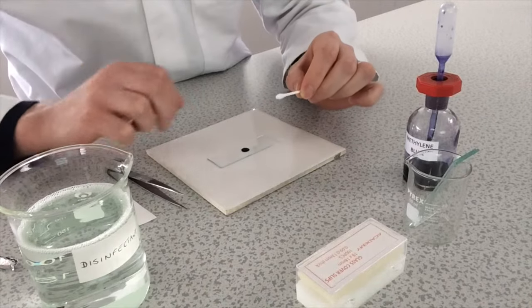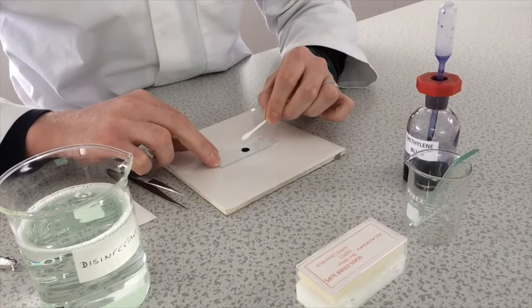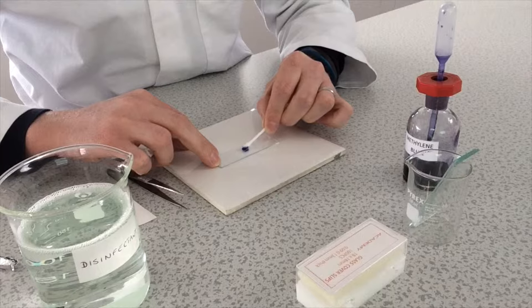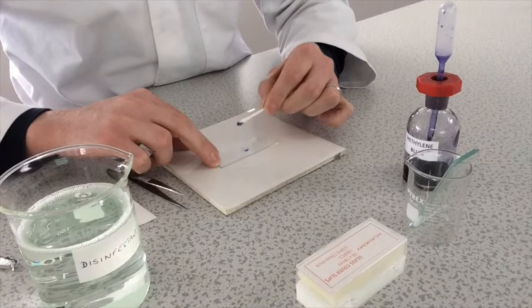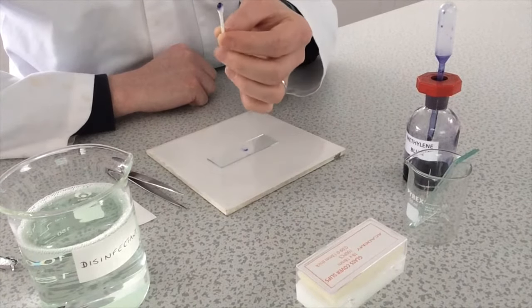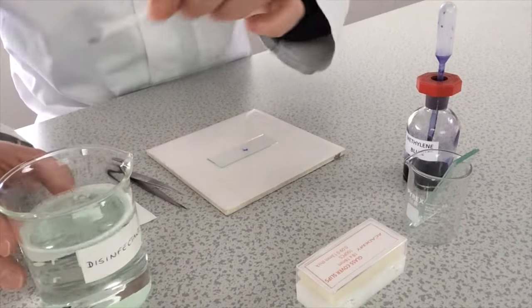Now once I've done that I will wipe the end of this cotton bud in my drop of methylene blue and then when I'm finished with this I simply place this cotton bud into a beaker of disinfectant.